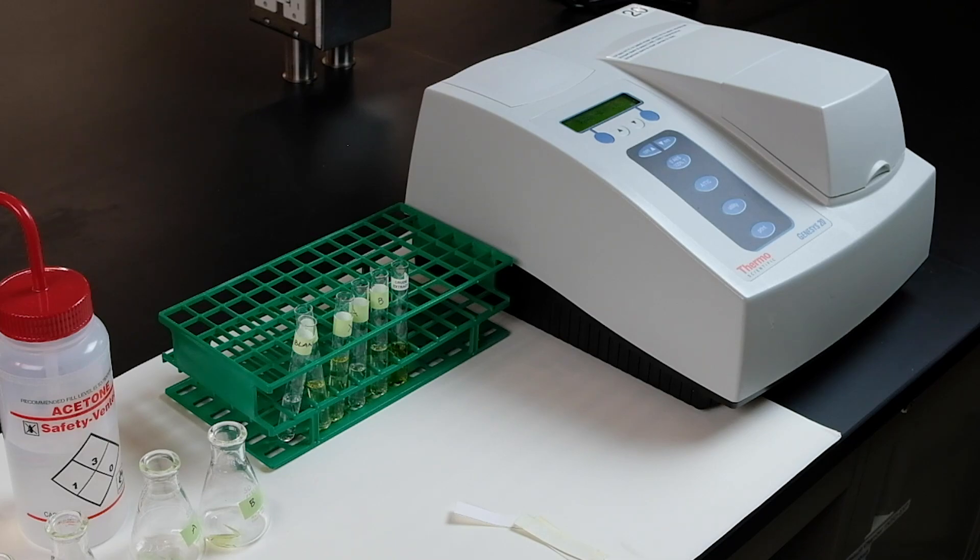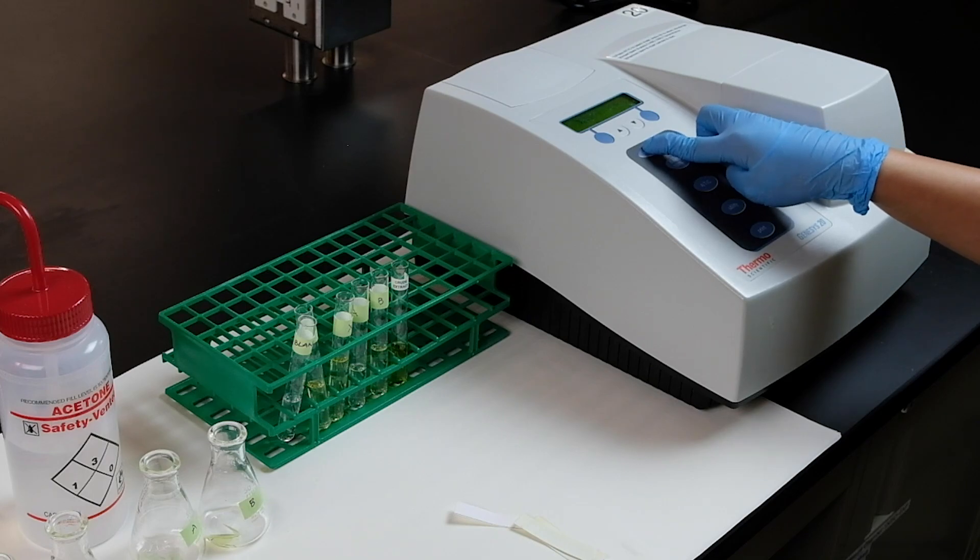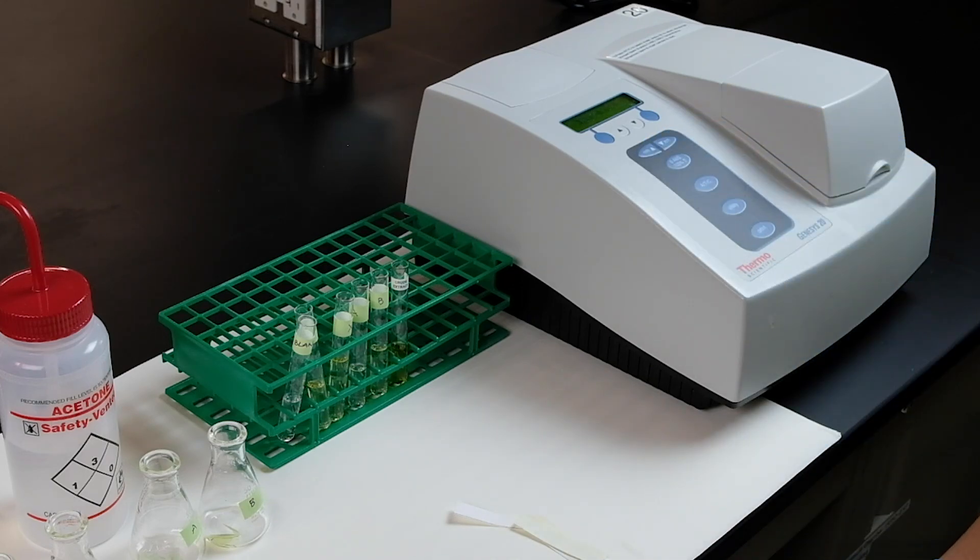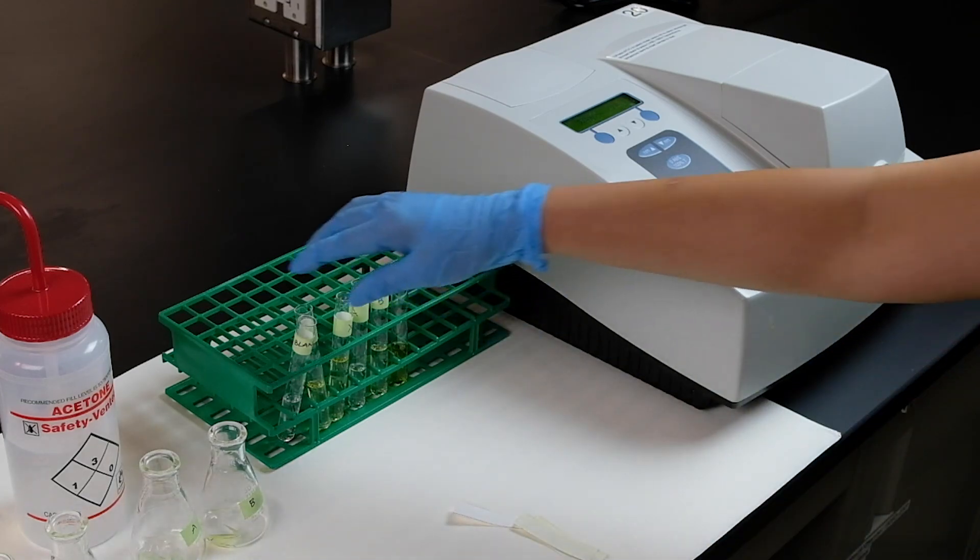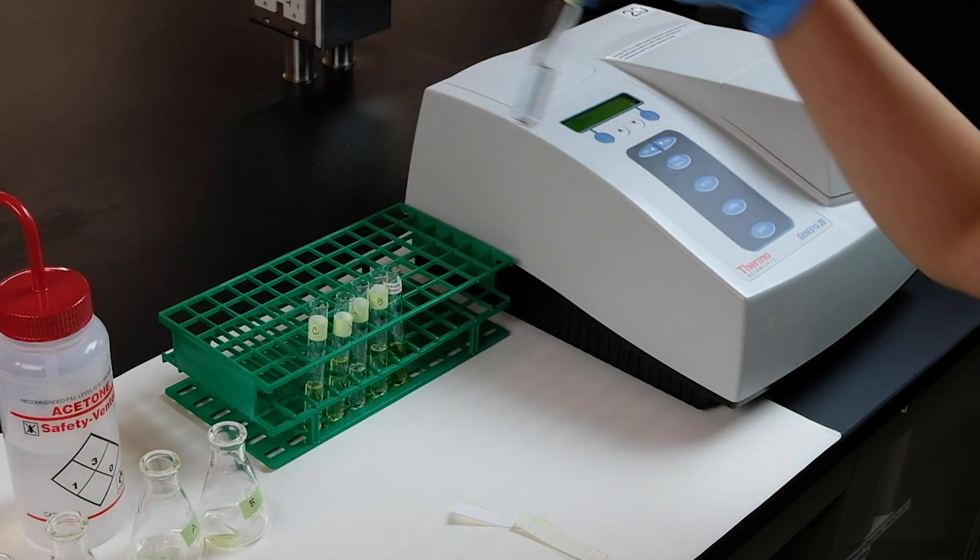After the first series, you use the up button to increase your wavelength to the next one in the increment of 10 to 390 nanometers. With the second set of readings, you do all the same tubes with the same procedure again, starting with the blank.